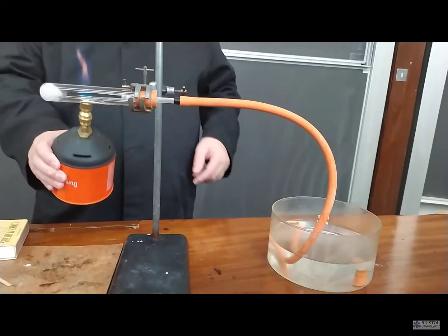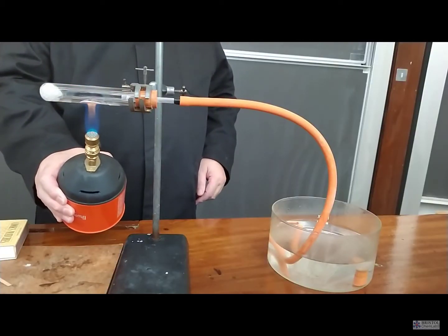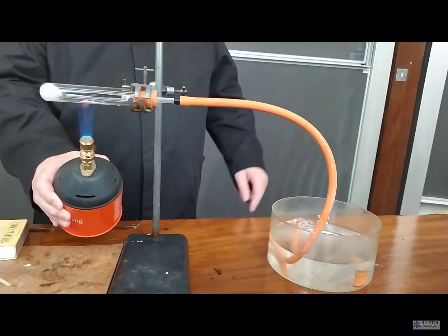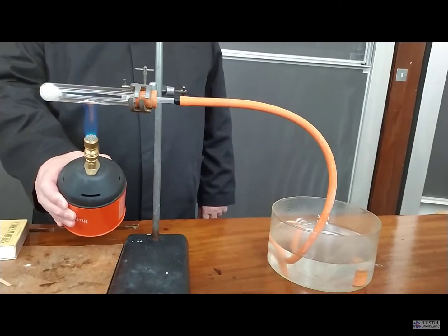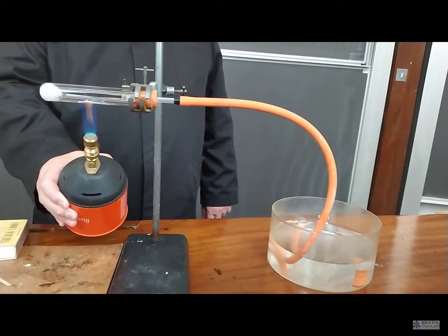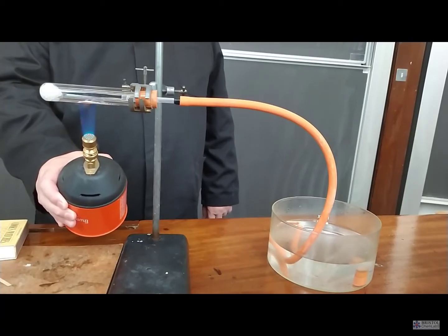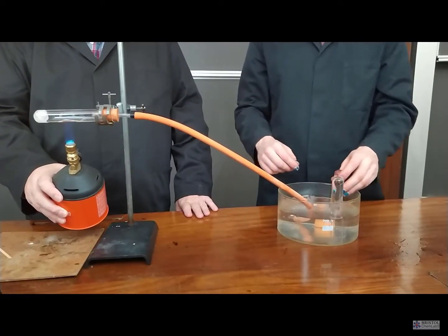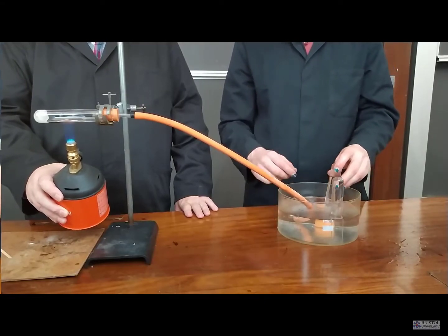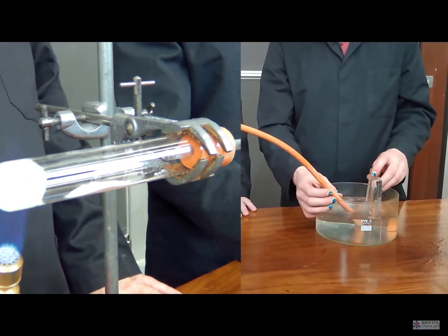Initially the catalyst is heated. Catalysts, of course, speed up a chemical reaction without getting used up, and if you warm up the catalyst it increases the rate of reaction further. Ignoring the first few bubbles of gas coming off, because that will simply be expanded air.